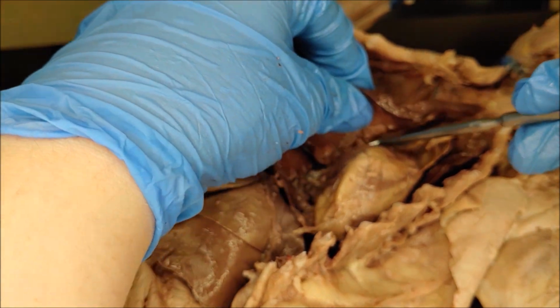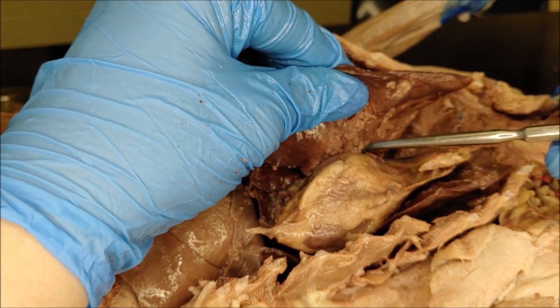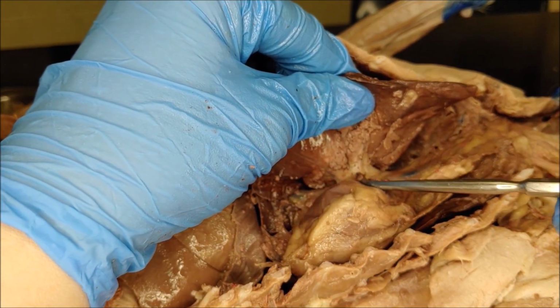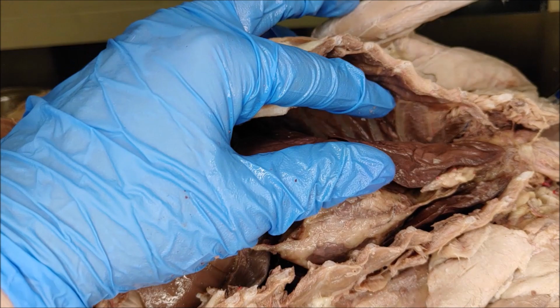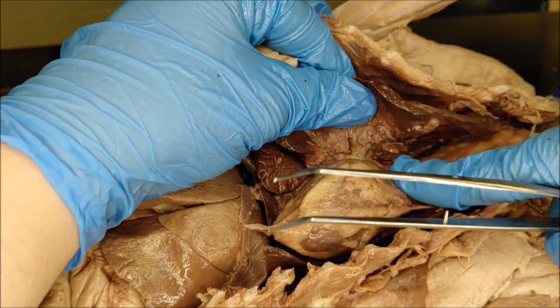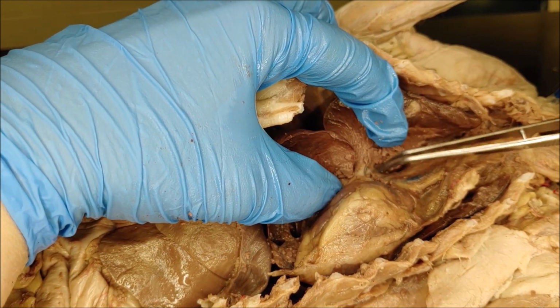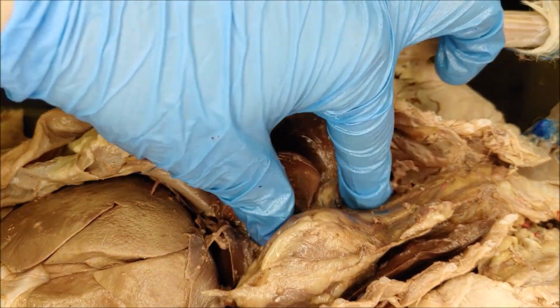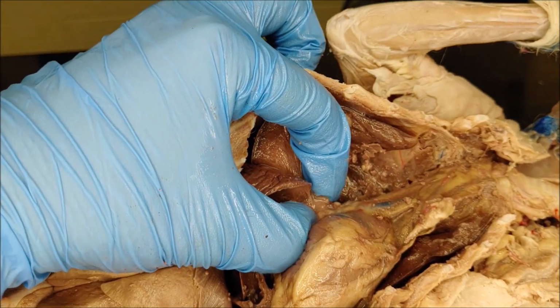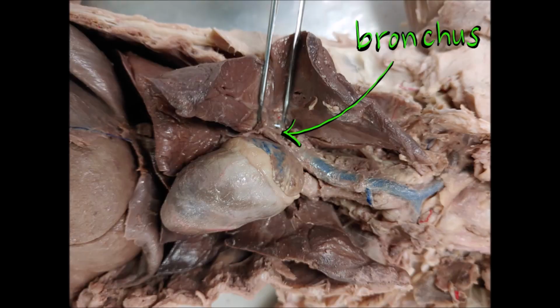If we follow the trachea down, we can see the lungs, which I'm holding right there, and then the bronchi are the tubes that lead from the trachea to the lungs. They are covered here in connective tissue, and the trachea goes behind the heart, so it's kind of hard to see, and it's actually easier to feel than it is to see. But if we get some of this connective tissue away, we actually see more of the pulmonary arteries and veins, but you can pinch just between the lungs and the trachea behind the heart, and you can feel the bronchus a little better there.